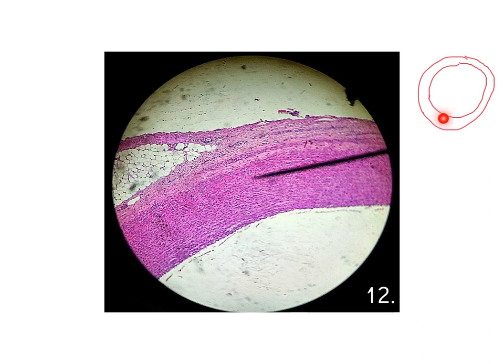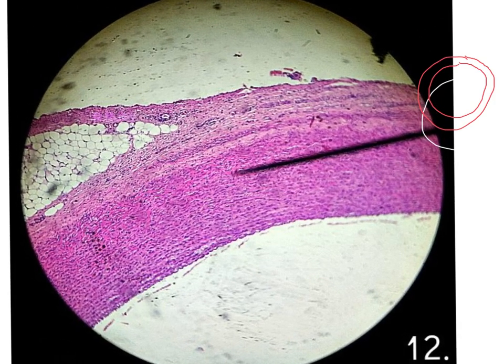You will look for this red wall under the microscope, and by looking at it you will notice that it is formed of many wavy elastic fibers. In between you have the blue dots representing the nuclei of the smooth muscles. Inside the lumen it is more or less empty. So, empty lumen and wall formed of parallel red elastic fibers separated by these nuclei of the smooth muscle fibers.